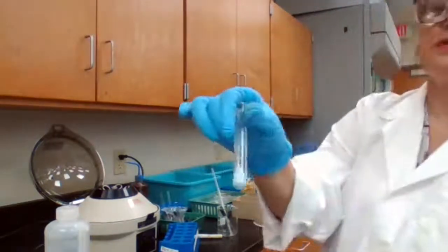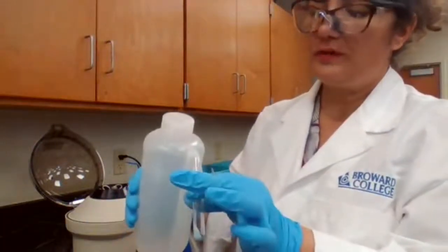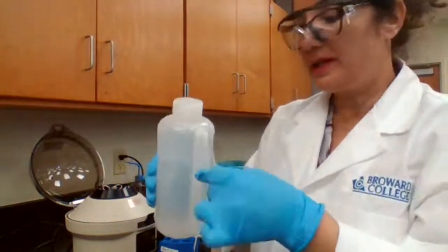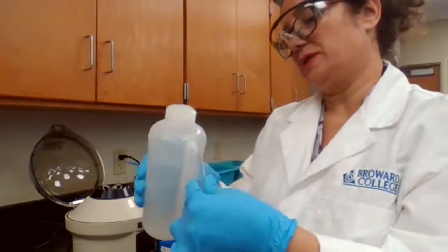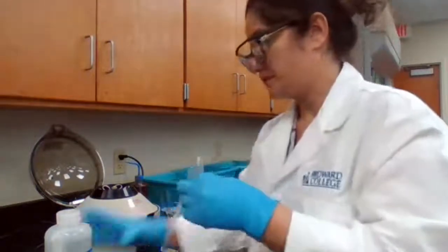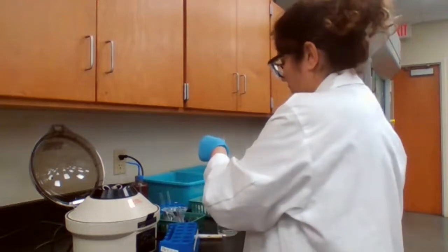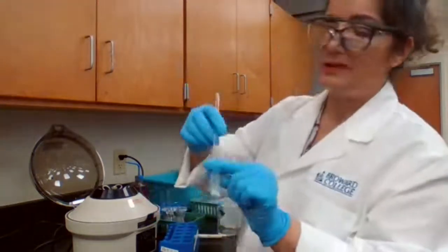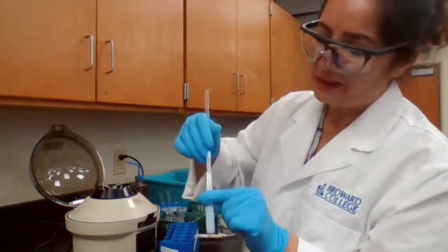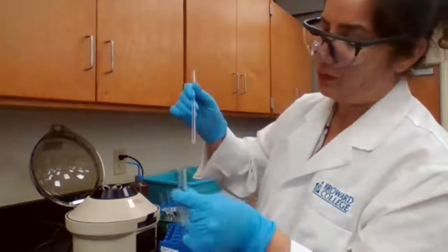We have this white precipitate that is bismuth, but to confirm it, it appears light blue. Why does it appear light blue instead of white? Because it needs one more washing. We try to get all the copper out. Make sure if you're using a stirring rod, your stirring rod is clean before each use. You clean it. You don't trust that someone left it and nobody touched it, especially when you're working with someone else.